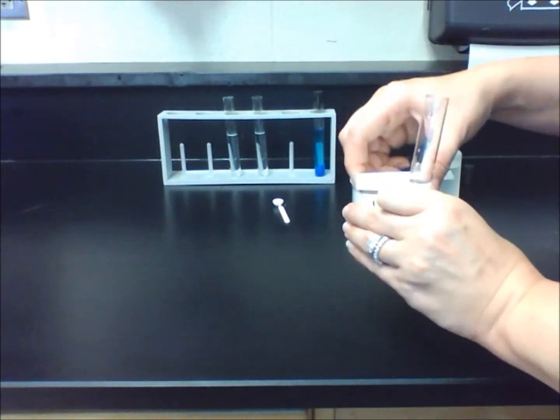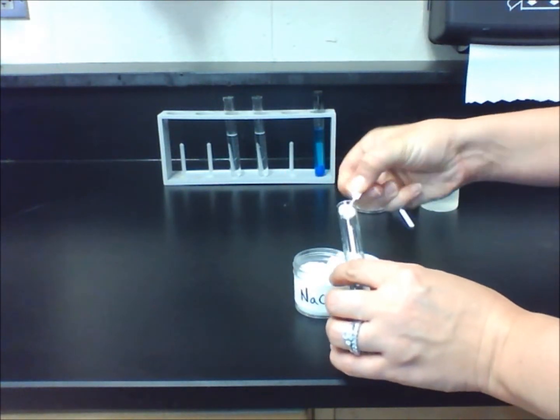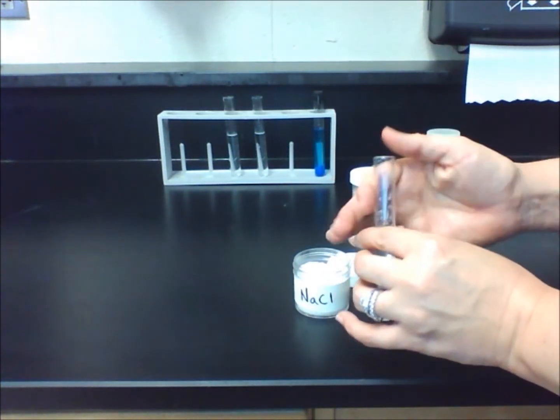Let's fill a test tube about halfway with water and put one level lab scoop of salt into the test tube. Shake the mixture to help the salt dissolve faster.